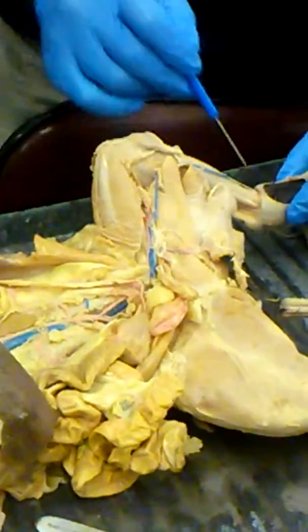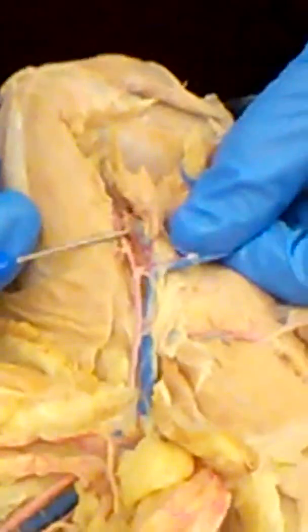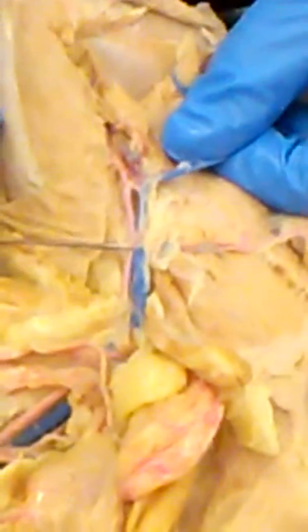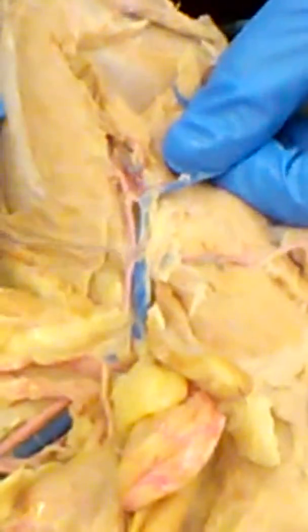The long vein here that you see going all the way up the leg is called the great saphenous vein. Right? If you follow this, there's a split, and there's another vein that comes from the kneecap, which is right here under my pointer, and that's the popliteal vein. We're going to follow back up. This area is going to be called your femoral vein.